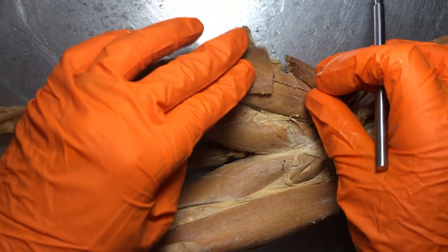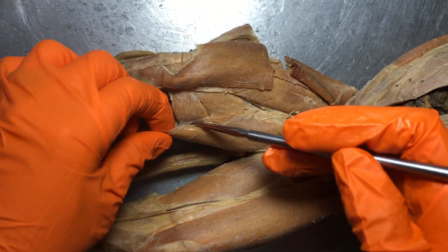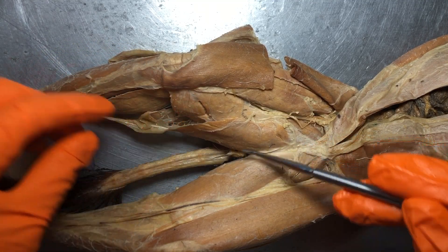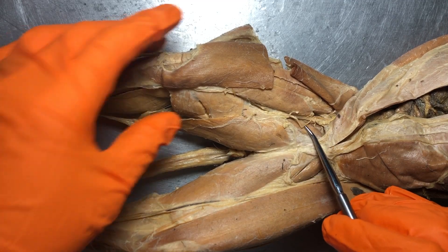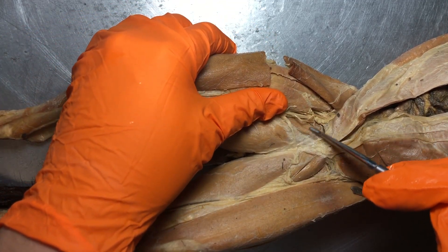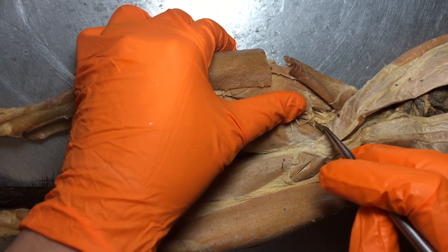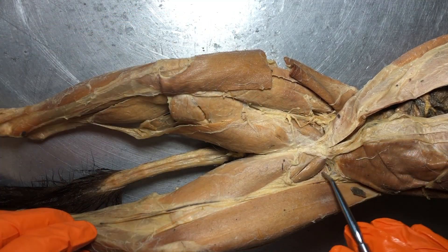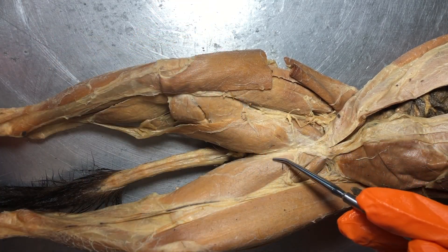If you're curious about the inner muscles, this is the gracilis right here. We have the semitendinosus and the semimembranosus. This is the adductor longus. And then we only see a very small portion — just that teeny bit right there — that is going to be the pectineus on our cat. Remember those make up the major adductor muscles.